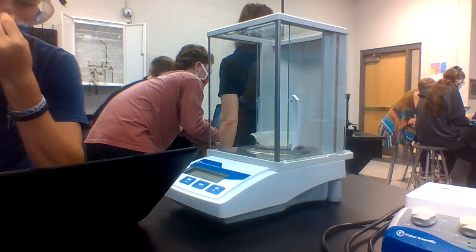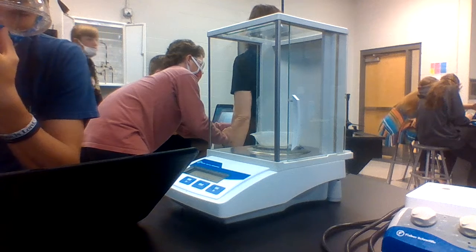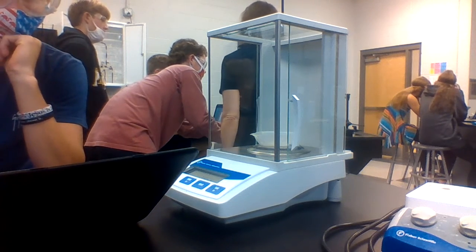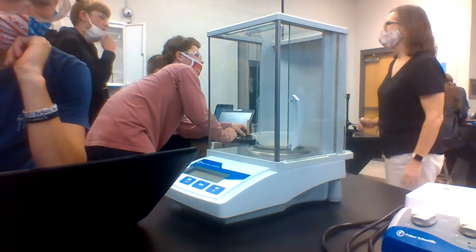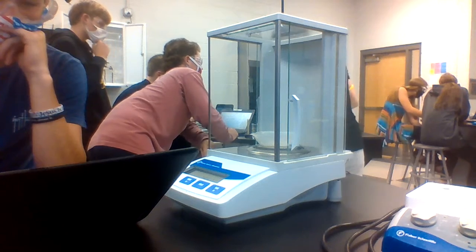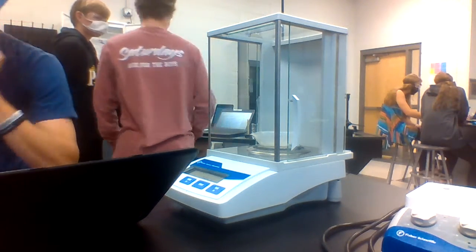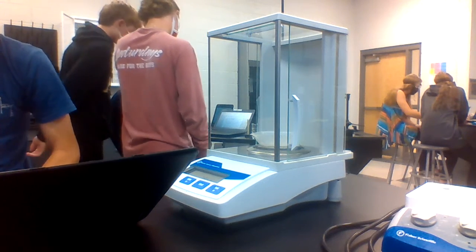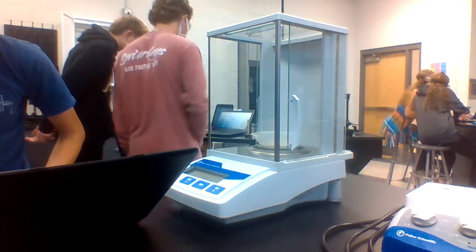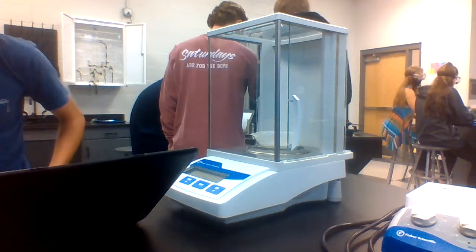Wait, I'm very confused. Me too. Where do we put this? Where do we write the thingy? Oh, I don't think we do it in that chart. Okay, you're good. Where do we write this number? In your data table where it says mass, right here? Yeah. So the volume is going to be your 1 milliliter, and the mass is whatever the mass is.